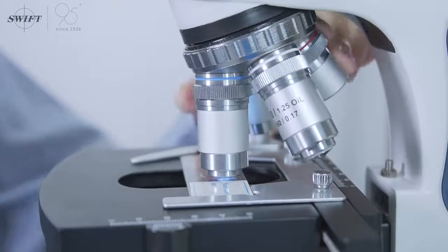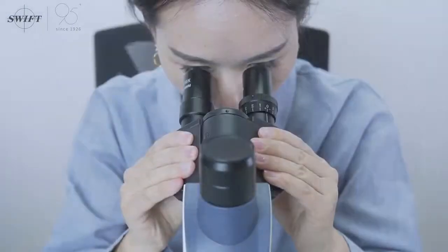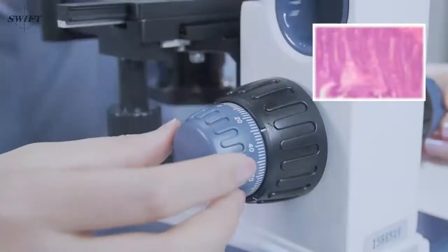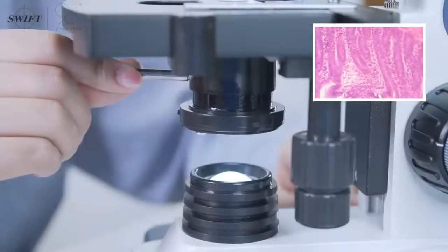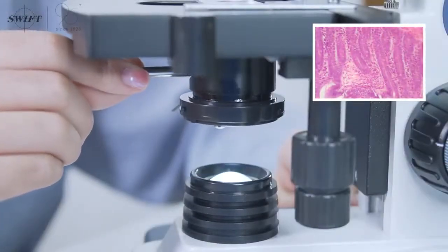Use the high power objective lens to observe the details. The process and method are exactly the same as the low power objective lens operation process.